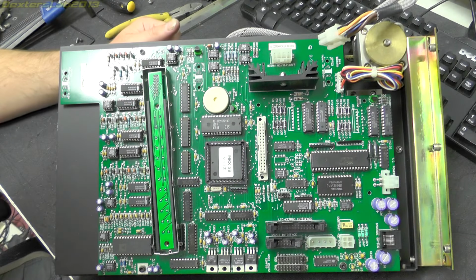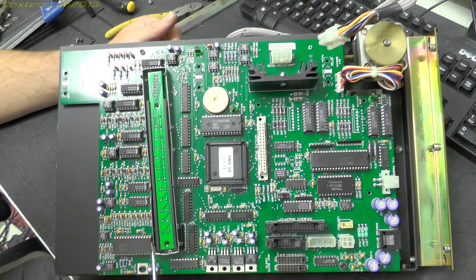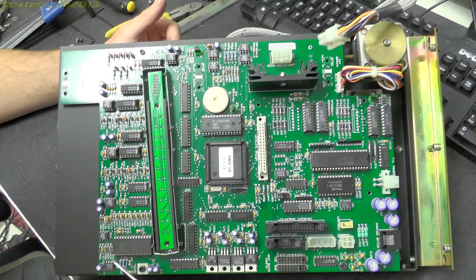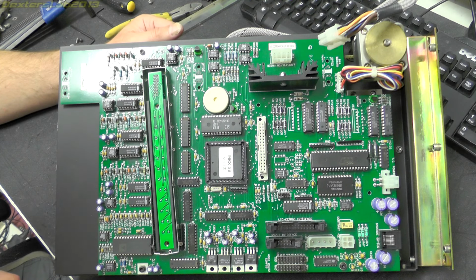Right, let's have a quick look through some of the ICs in this. So we start at this end. Obviously we've got the diode array, so that's going to be an analog signal. So there's going to be a whole load of analog conditioning, and then it's going to run into the analog to digital converter. This device here is an Analog Devices 7871JN, which is a 14-bit ADC and runs at up to 83 kilosamples per second.